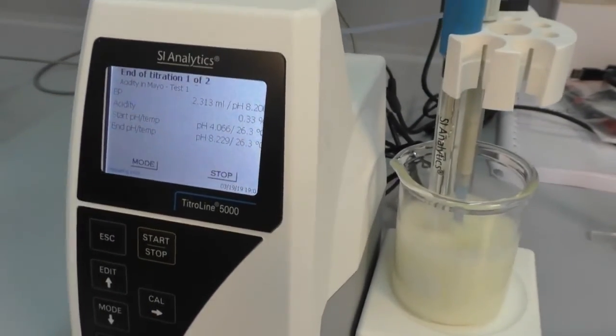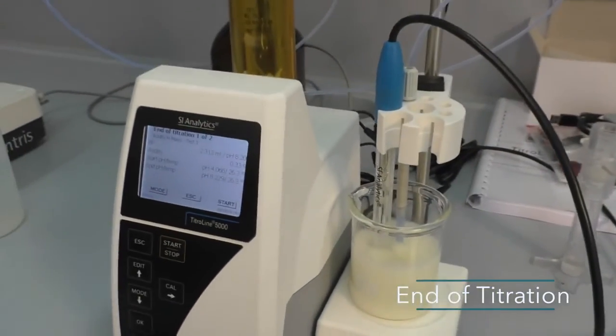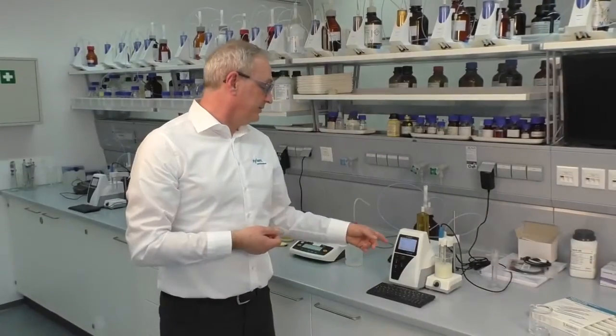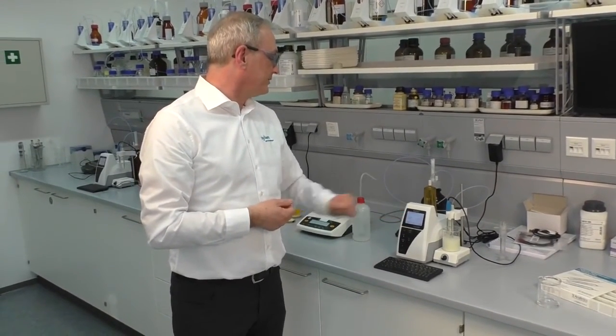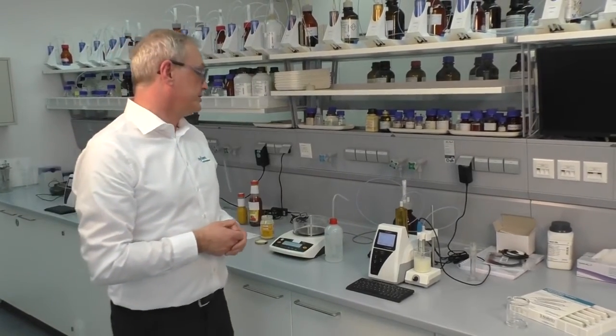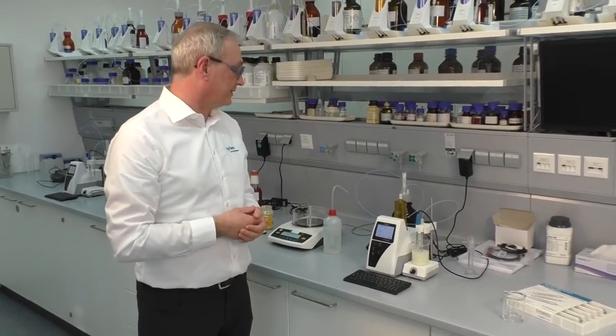And the acidity was 0.33%, which is typical for mayonnaise. At the end of the titration, the titrator shows the result on the display, or if a USB stick is connected to the titrator, the titrator automatically generates a PDF file and it's stored on the USB stick.